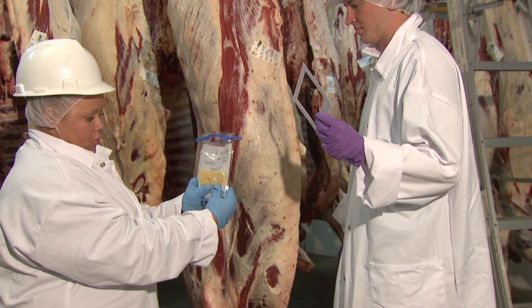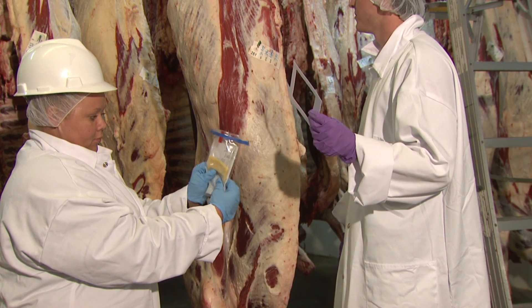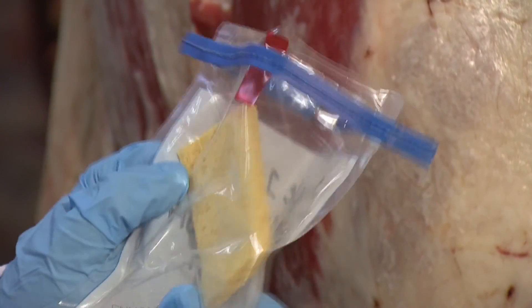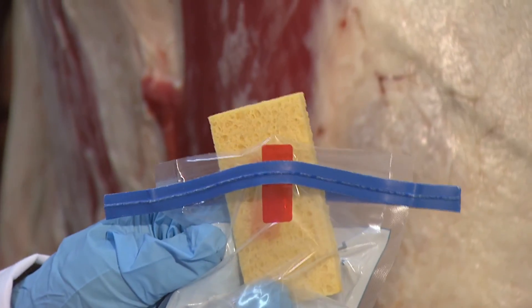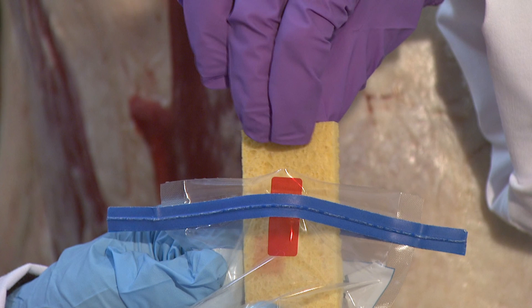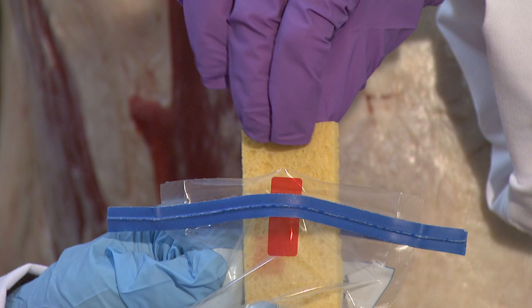Next, the person conducting the sampling will remove the sterile sponge from the bag. The assistant works the sponge to the top of the bag. With sterile gloves on, the sampler removes the hydrated sponge using the thumb, index, and middle fingers of the sampling hand, carefully avoiding any contact between the sponge or gloves and the outside of the bag.